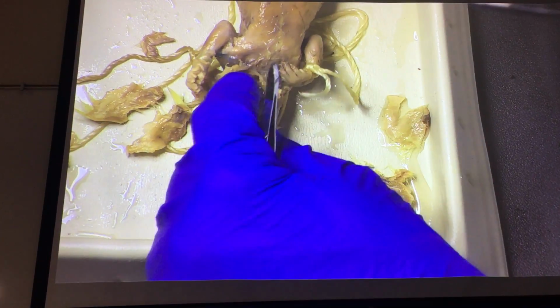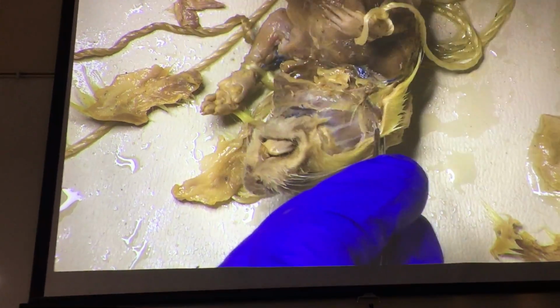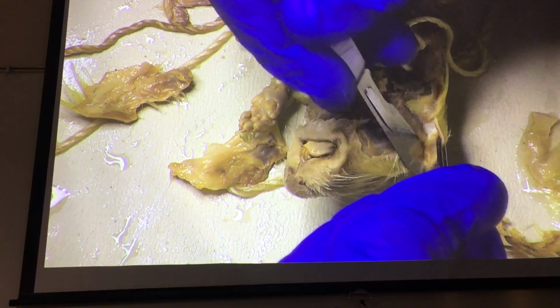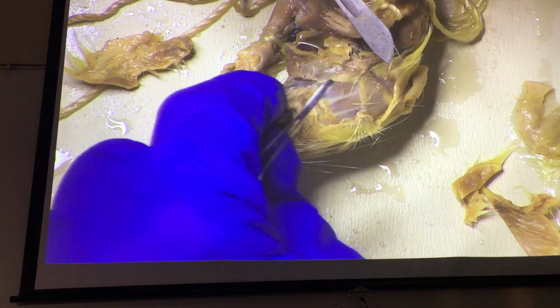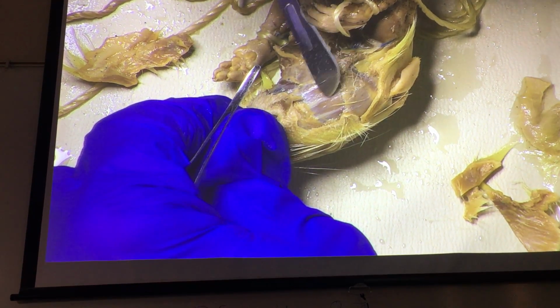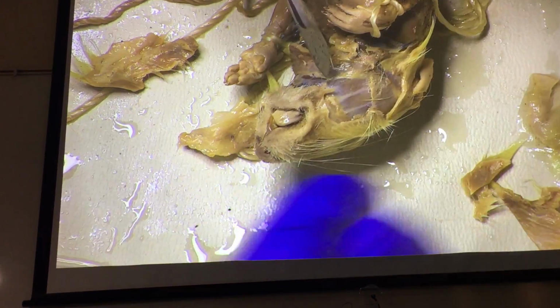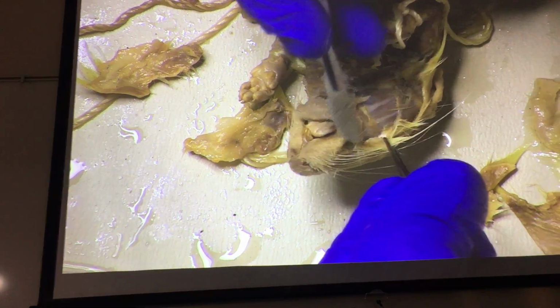But it's all going to be so small you're not going to be able to see that, but it's kind of neat. So right here, as I flip the rat's face over at the moment, we can see something that you felt in yourself in a lecture. Remember when I had you feel the opening of your parotid salivary duct? There it is. There's the parotid salivary duct right there. Coming from our parotid salivary gland, which is sitting right here. Parotid, of course, near the ear, otic capsule, right?